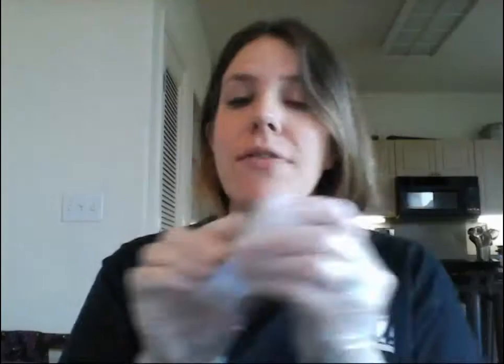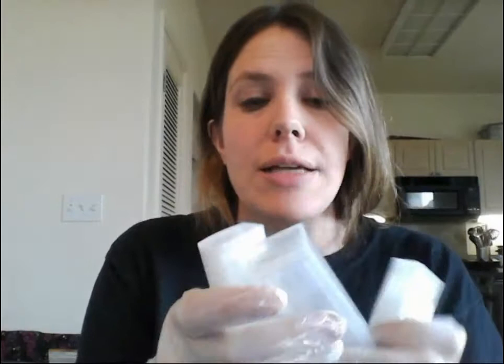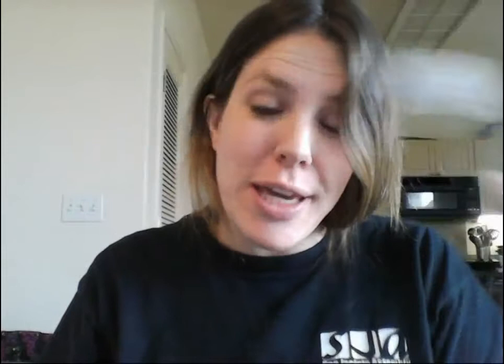Let me demonstrate how to put a slide on. You have little cases of slides — two came with your microscope and are glass, some prepared and some blank. Your lab-in-a-box kit came with the Carolina DL Basic Slide Set 1. The first slide you're going to use for this lab is the one called the letter E. Just like Sesame Street says, today's lesson is brought to you by the letter E — it's literally a letter E, already prepared for you.